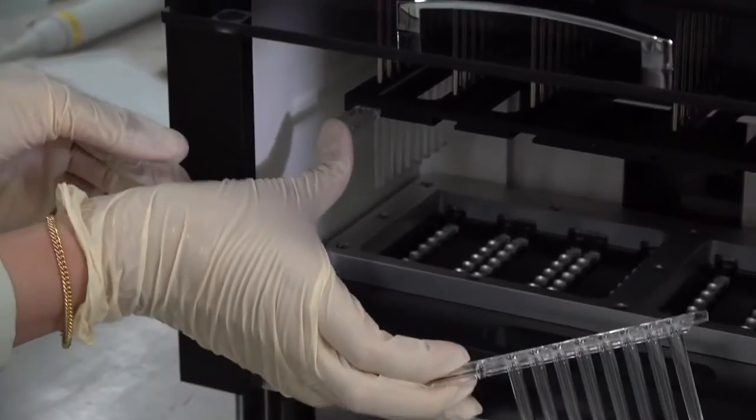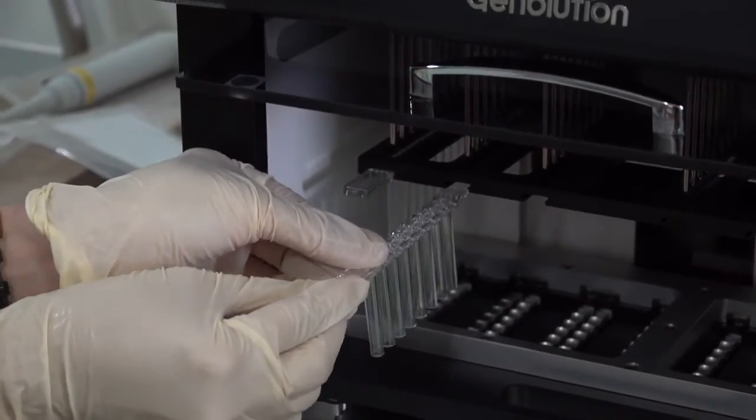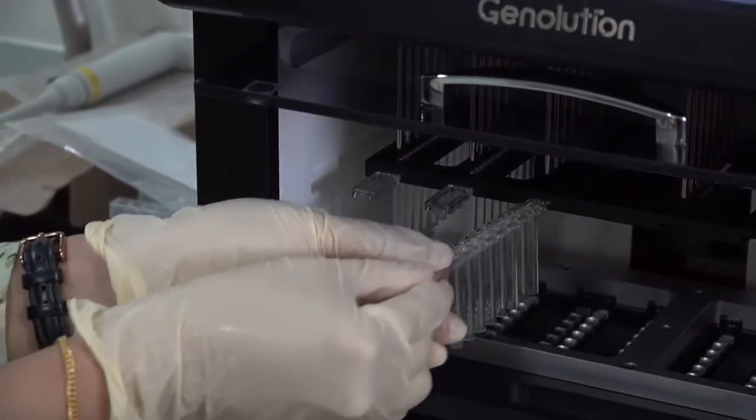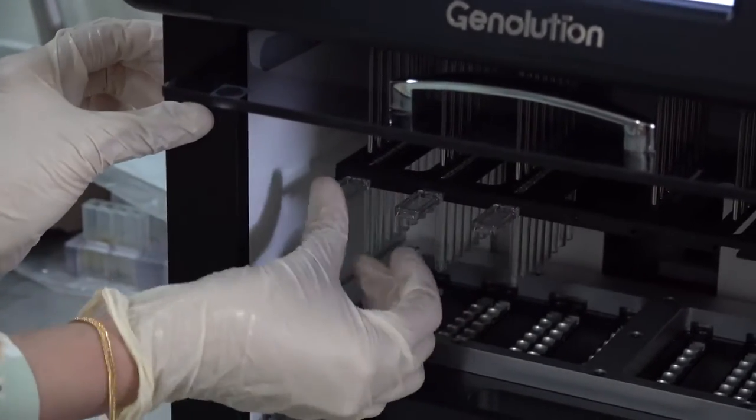The strips have to be installed in their respective receptacles and all the strips must be locked in tightly. There are three strips which are being installed over each well.